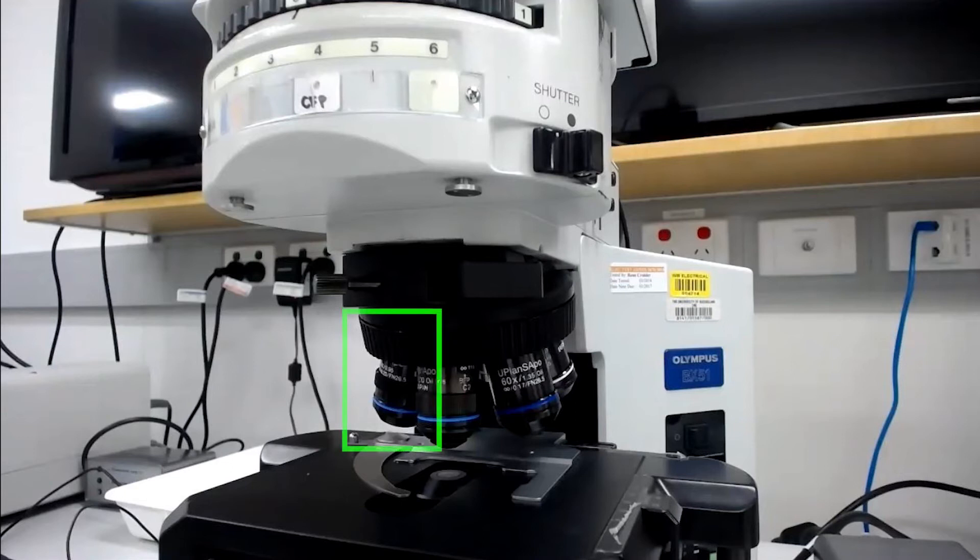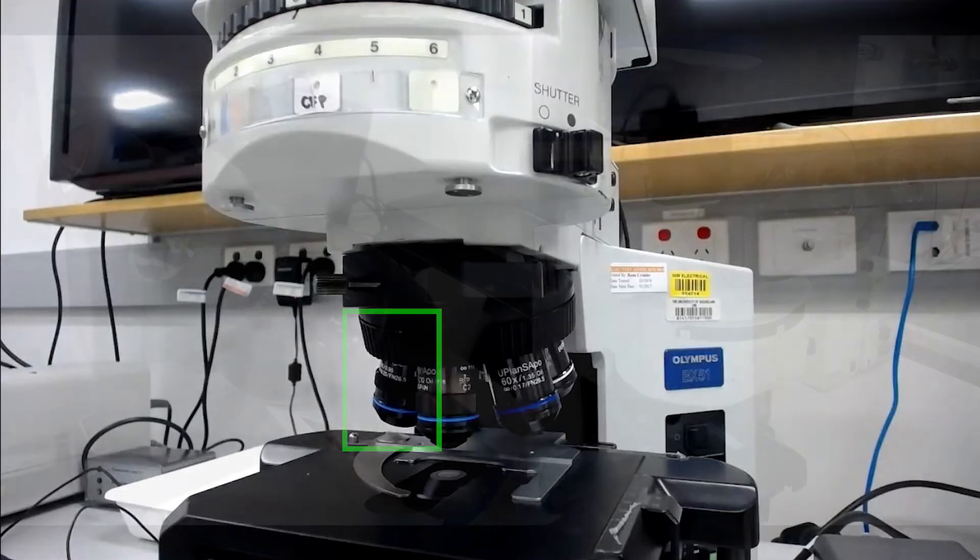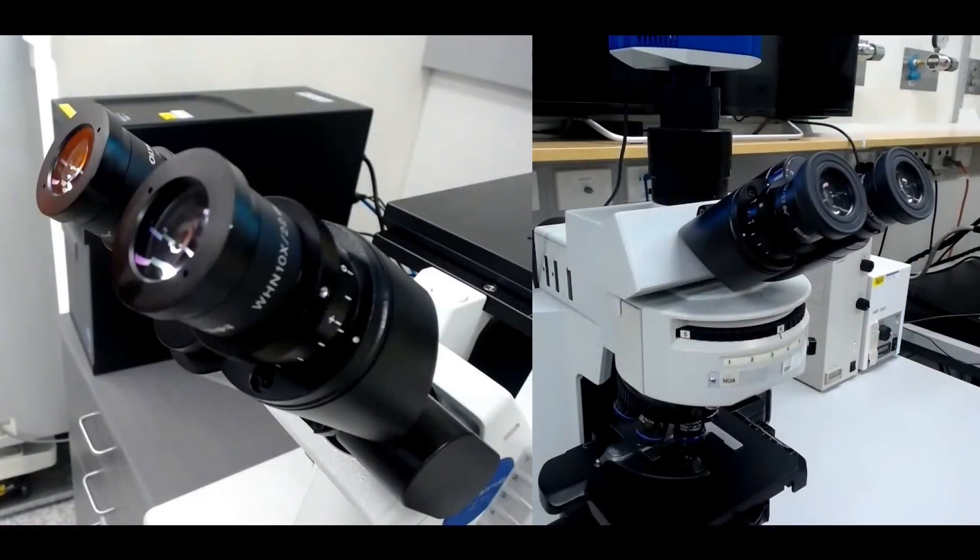Move up to the highest magnification dry objective and repeat this procedure. This final adjustment is the one that you want to take note of and set the eyepieces to every time you use this microscope.